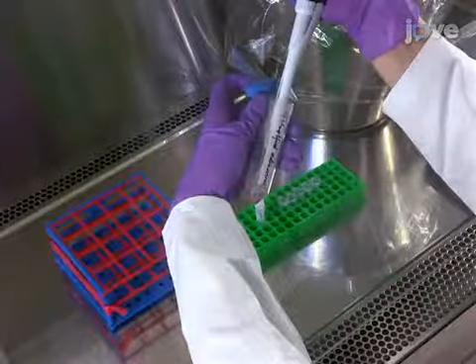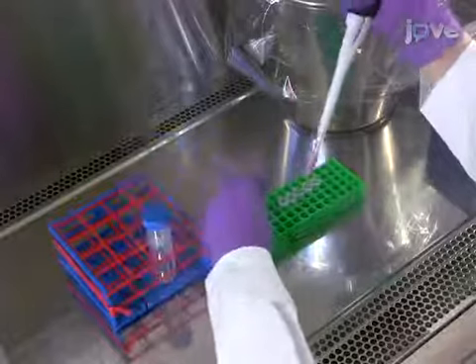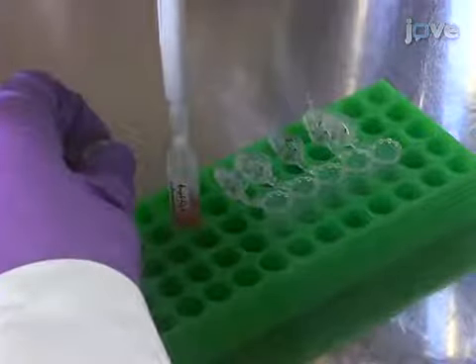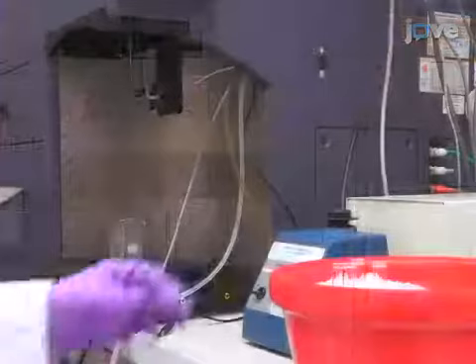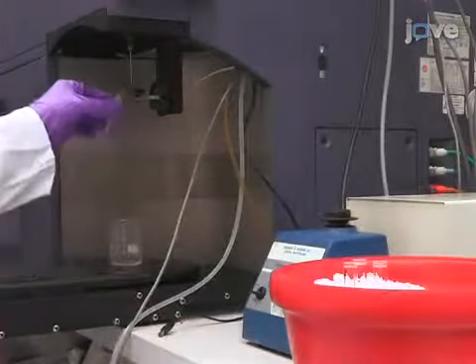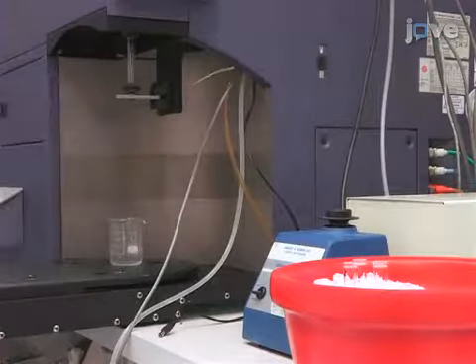After the spin, carefully transfer the supernatant, which is now referred to as the concentrated virus lysate, to a cryotube. Make aliquots for multiple infections and store them at -80 degrees Celsius. Finally, determine the virus titer by FACS analysis of infection marker expression in A549 cells according to the instructions in the accompanying document.